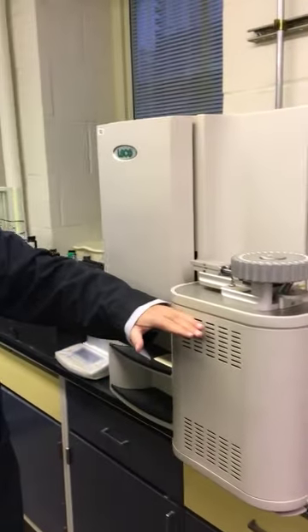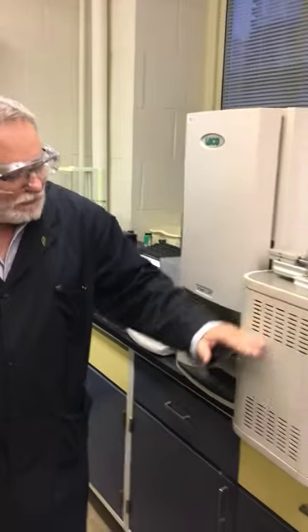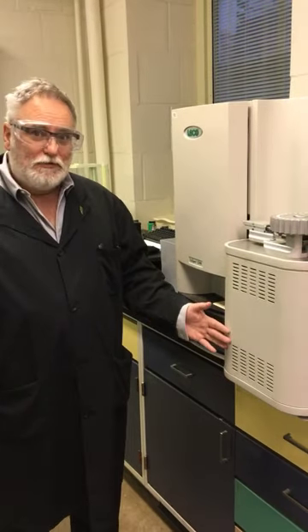When the system is ready, the shelf is retracted; we use compressed air to do these movements. The sample falls down to the primary furnace, where there is a combustion in ultra pure oxygen. Again, read the ASTM for these sorts of details and what the allowable temperature range should be.